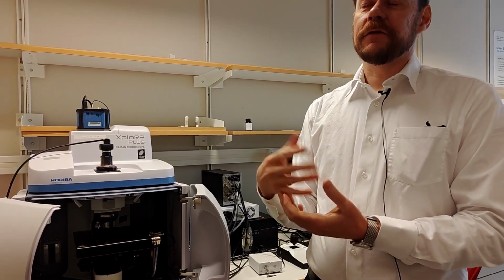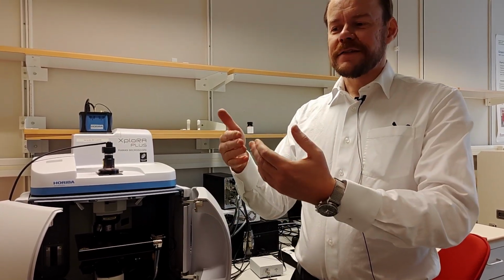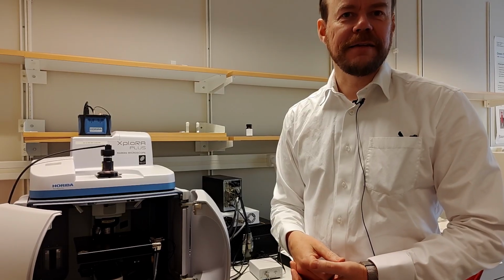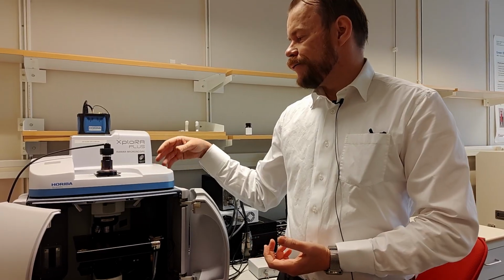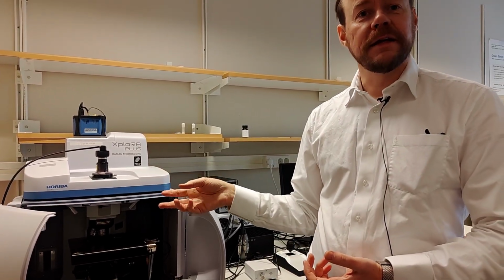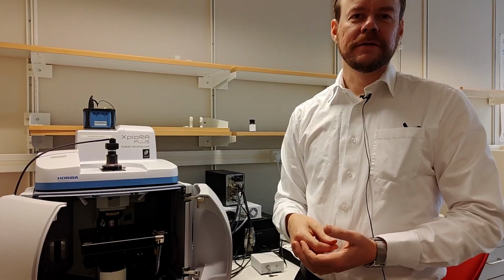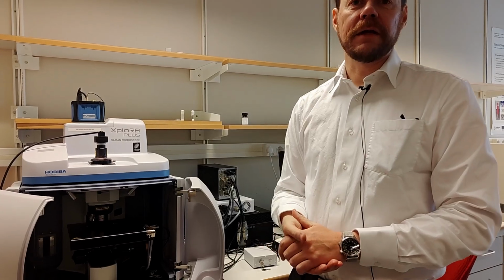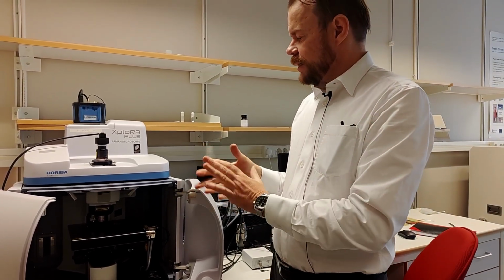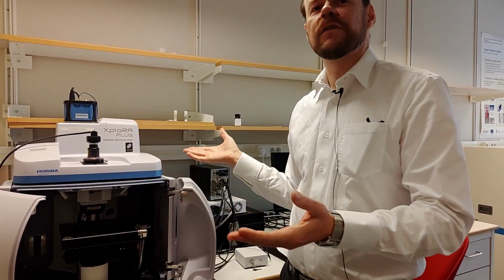You can also, if you don't want to do a depth profile, a classic thing is that you want to find out what something behind the glass contains. For example, Raman spectrometers can be used to verify a medical component inside a glass bottle without opening the glass bottle, right? So that means you put the focus inside the liquid of the bottle. You can't fit a bottle in here, but theoretically you could do that with a Raman spectrometer. So it's very versatile, very easy to use, and it's quite fast to take a measurement with this.